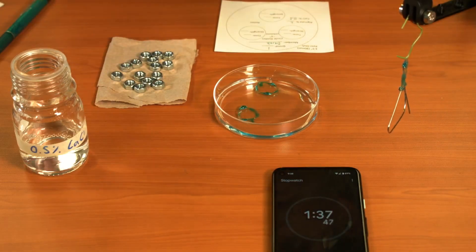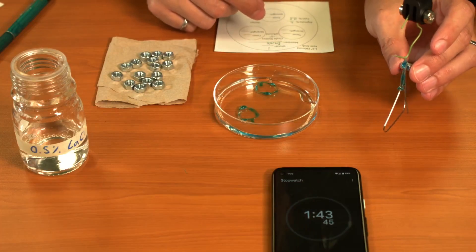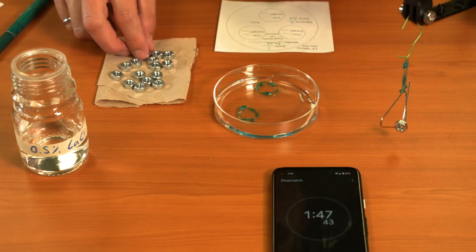What I do is I want to see how many of my weights I can hang from this ring before it breaks.